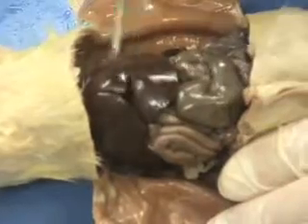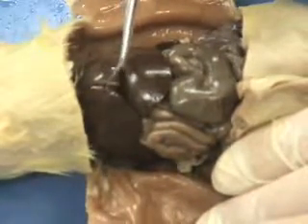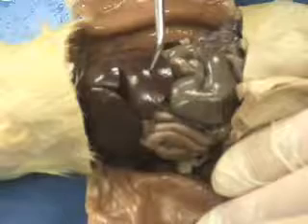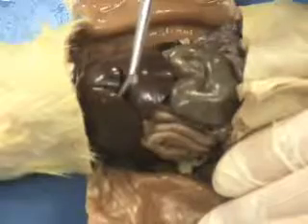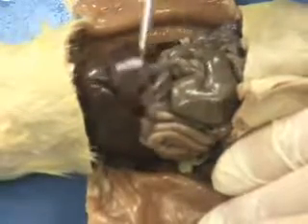The liver has 3 lobes, and the directions that you have received tell you to identify some of the functions of the liver. We've talked about the liver in virtually every single unit so far. So if you went back to any of the notes from the circulatory system, digestive system, even the respiratory system and the excretory system, you find some functions of the liver. It comes as 3 different lobes.